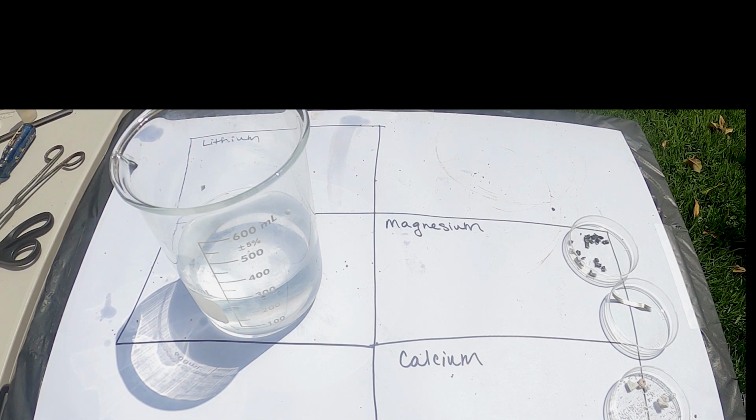That reaction started a lot faster and is producing a lot more smoke. This reaction often produces a flame as well, but I'm trying to use very small amounts of reactants. Oh, I thought I saw a spark.